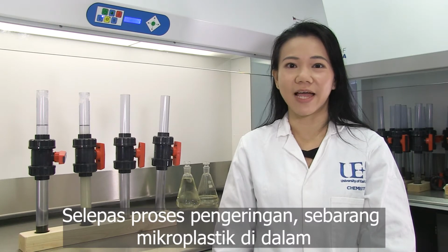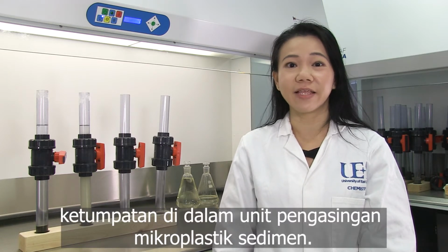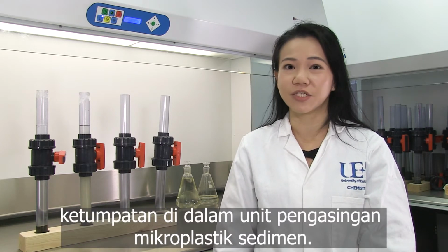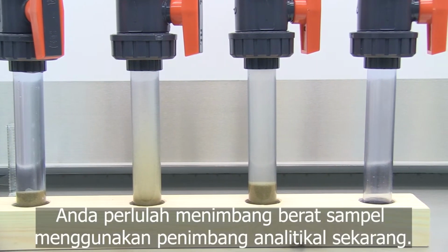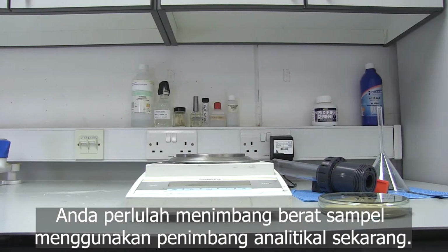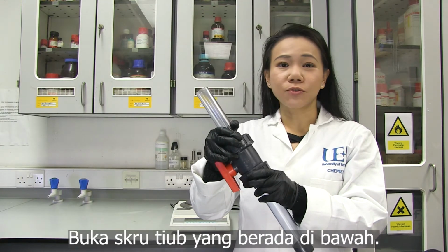After the drying process, any microplastic in the sample is extracted by a density separation method in the sediment's microplastic isolation unit. You now need to weigh your sample on an analytical balance. Unscrew the lower tube.